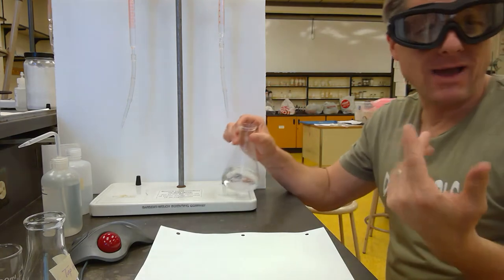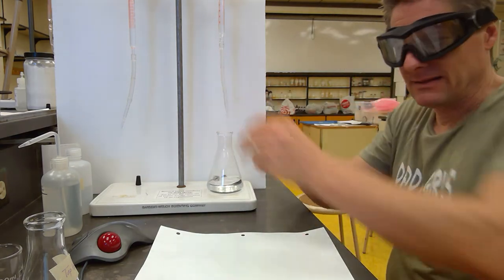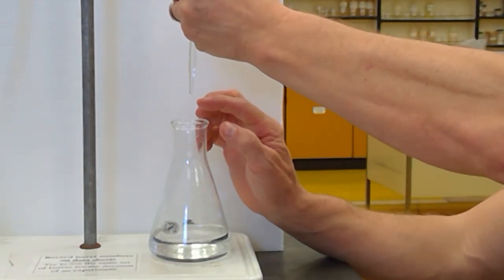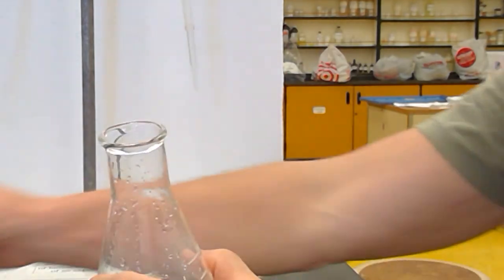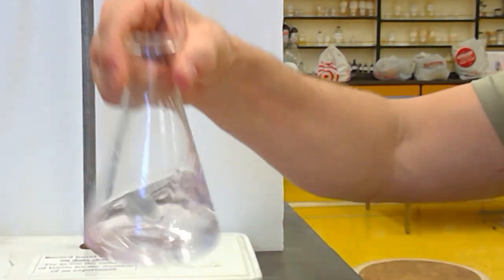That's it. And if I'm not talking, I'm doing this faster, right? So it usually goes faster than this. What I'm going to do is let's zoom in. I'm going to get about a half of a drop. I'm just going to get a little half a drop hanging off. Oh, that was more than half a drop, unfortunately. That was about 3/4 of a drop. Tap it off on the inside, spray it down. I'll probably have to back titrate it.